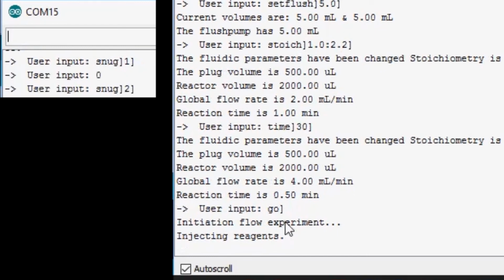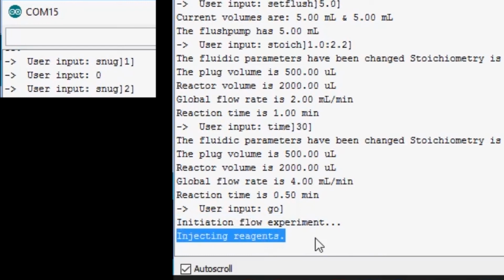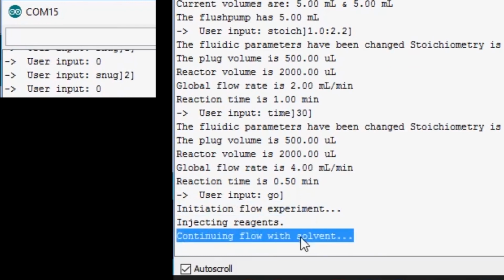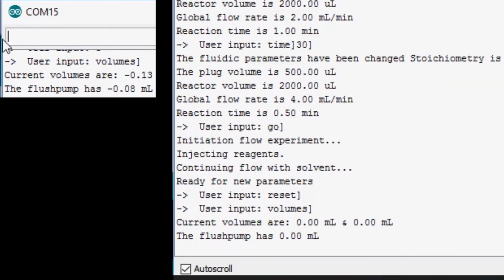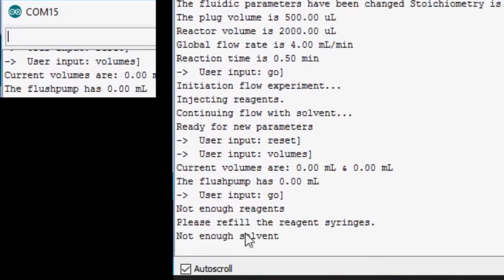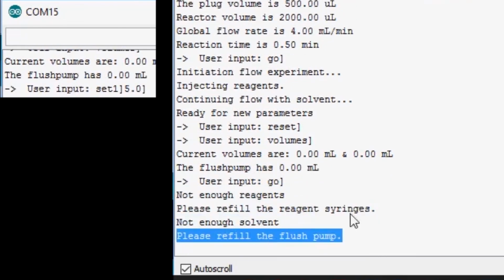You can see when the experiment is initiated and the reagents are being injected. This continues until the plug volume is achieved. Once that is done, the reagent pumps stop, and the flush pump takes over by pushing the plug through the reactor at the correct flow rate to maintain the reaction time. Once the plug exits the reactor, you are prompted to set new reaction parameters. If you don't have sufficient fluid in the syringes to proceed with a new experiment, like so, the microcontroller will warn you. This is to avoid starting an experiment only to have the plug get stuck in the reactor. And it's as simple as that.